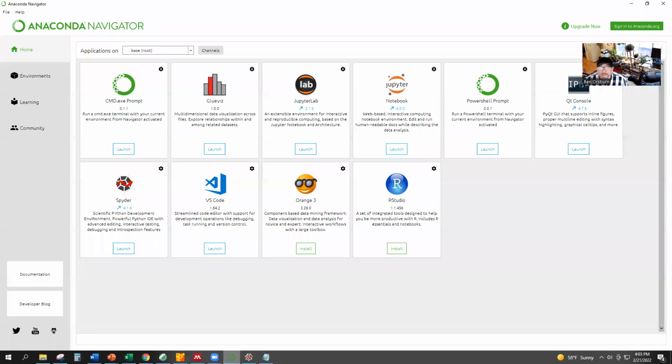What we're going to need is the Anaconda Navigator. You can Google this if you don't have it on your desktop. It's easy to find. And there are other ways, there are other IDEs out here. There's other ways to run Python scripts. This is just the way that I'm doing it because it's straightforward.